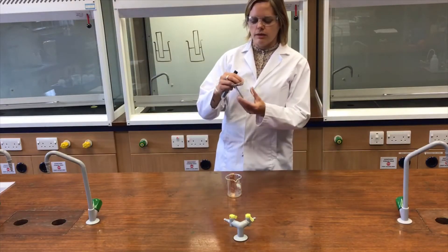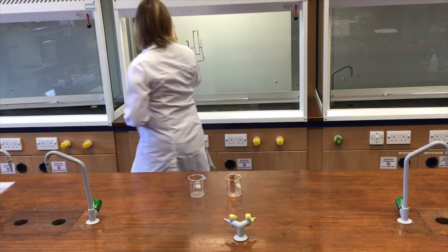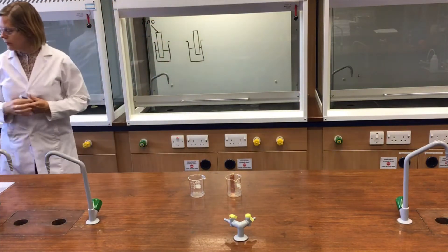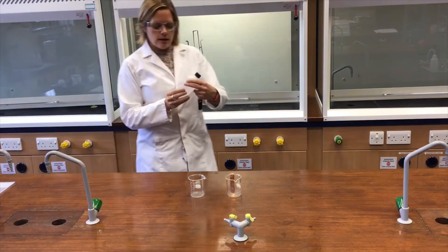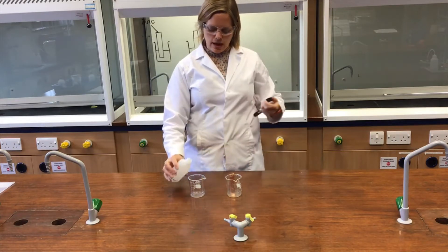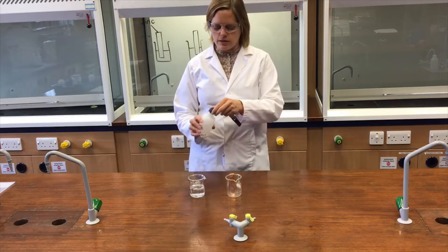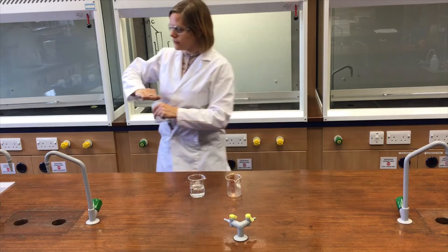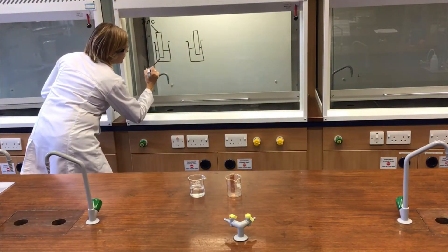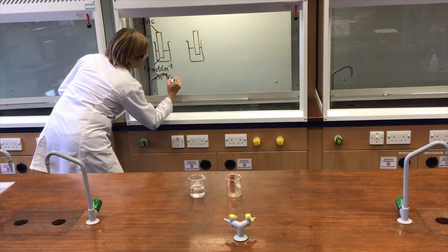Inside this beaker I have a strip of zinc metal. I'm going to add some 1.0 mol per decimetre cubed zinc sulfate solution — approximately half filling the beaker. That zinc sulfate solution contains 1.0 mol per decimetre cubed of Zn²⁺ (aq) ions.